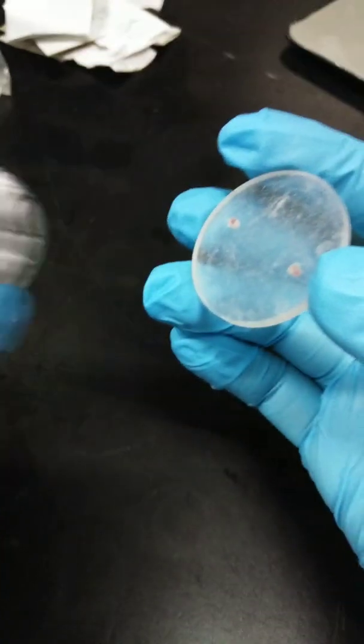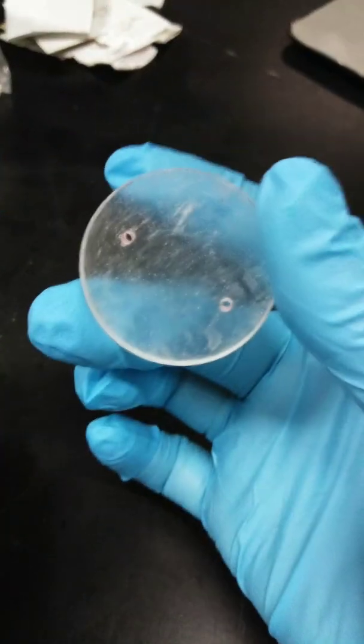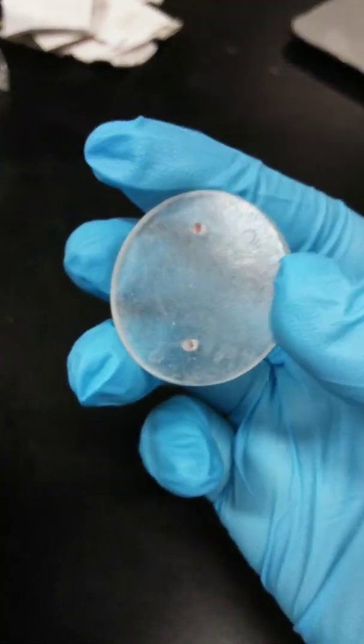Also, don't hold your KBr plate in this manner, on the surface. Don't touch it there. Only on the side. So we hold them here.